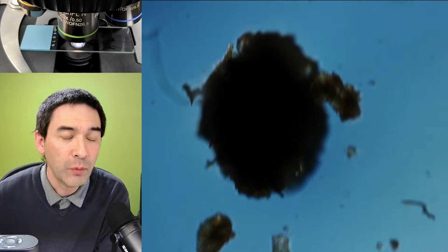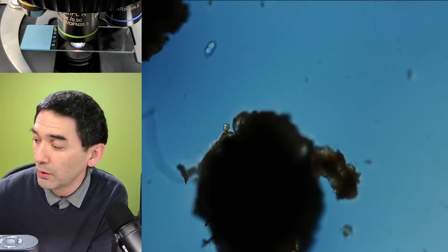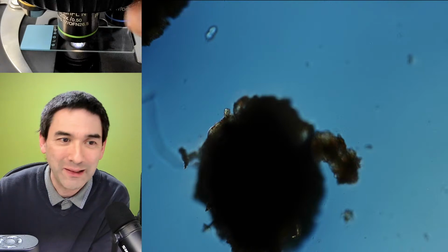What you've seen here already, hidden behind this particle, that is already a water bear. It's a live view of a water bear, and I'm just going to show it to you now, just in case I'm not able to find one later.